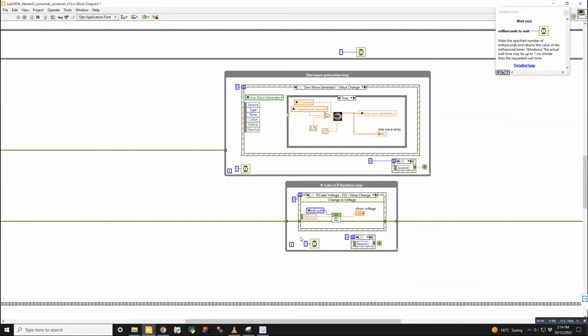If you let it just run as fast as it can, it'll do maybe 10 million loops per second. And that's just going to put a lot of strain on the processor very unnecessarily. Because if it's waiting for me to change a value in the K-Cube, it doesn't need to do that in nanoseconds. It's fine if it waits a millisecond to do that.